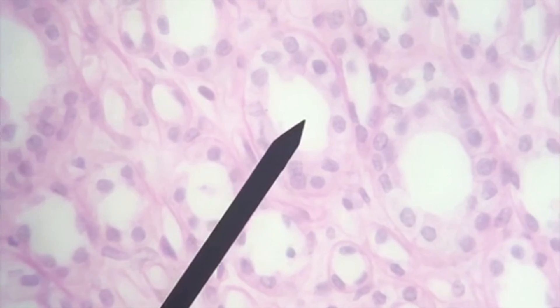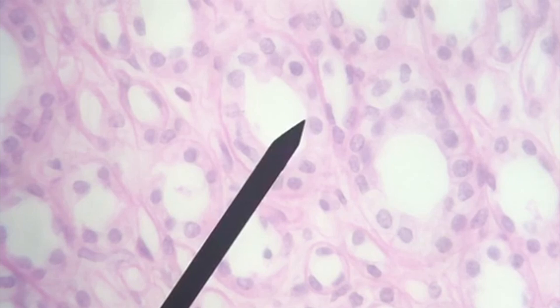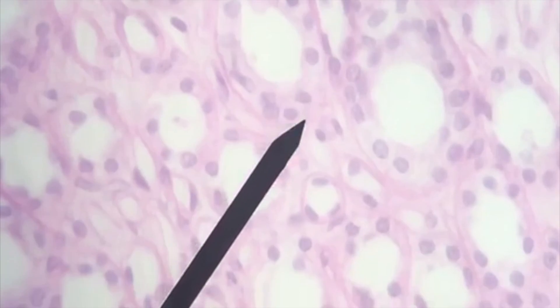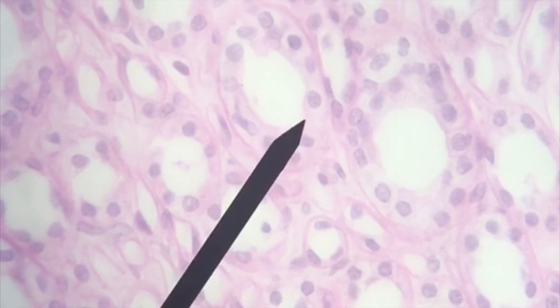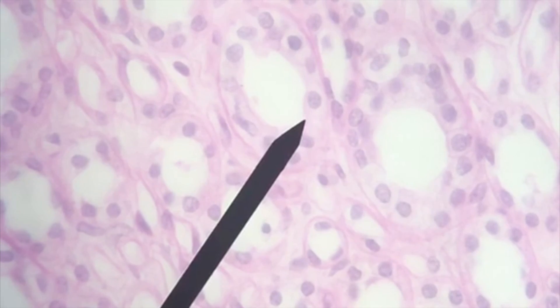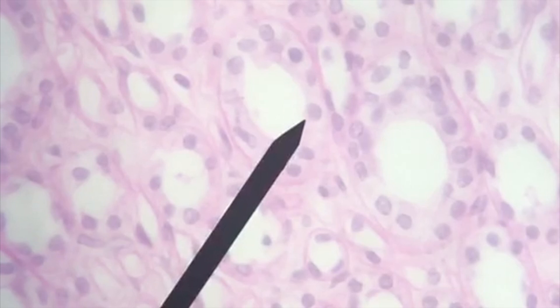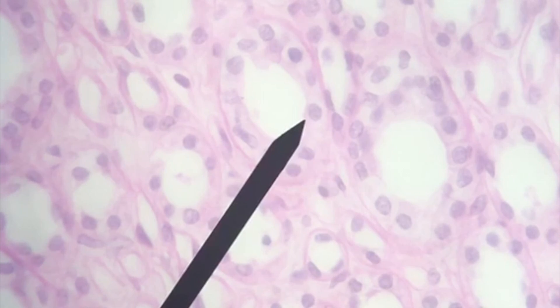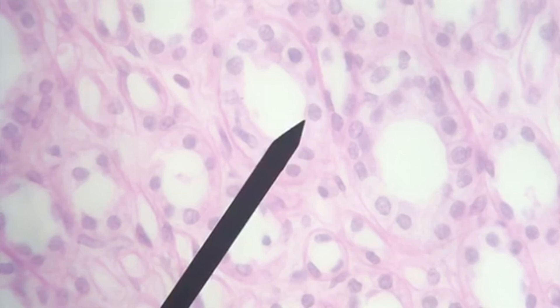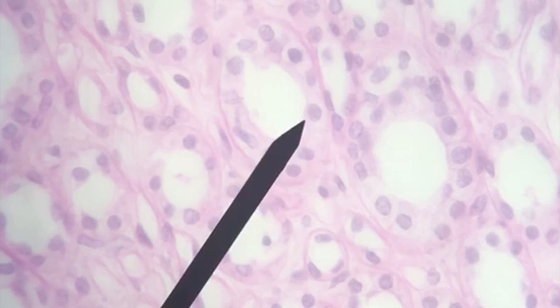We are now on a tube. The white space is the lumen. The pointer is moving to the apical surface. Remember, epithelium is lining tubes, forming tubes. We have a nice simple cuboidal arrangement here with a nice robust nucleus in the center, and we see some adjacent tubules below and to the sides.